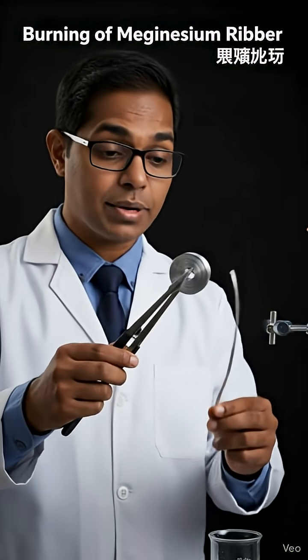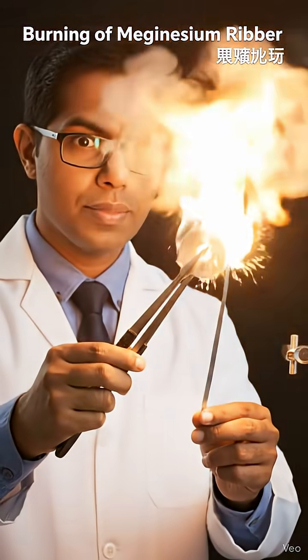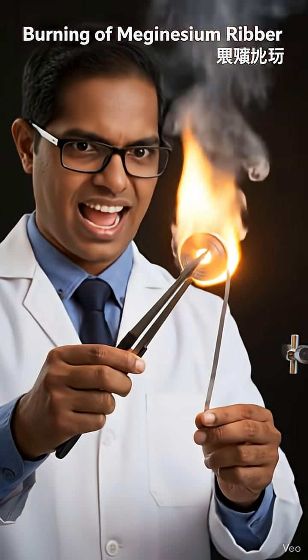Isn't it amazing that this tiny silver ribbon can turn into a bright white flame? Let's see what happens when magnesium burns in air.